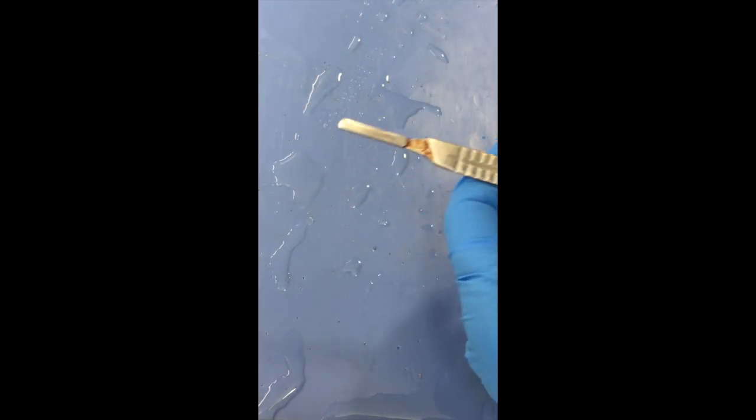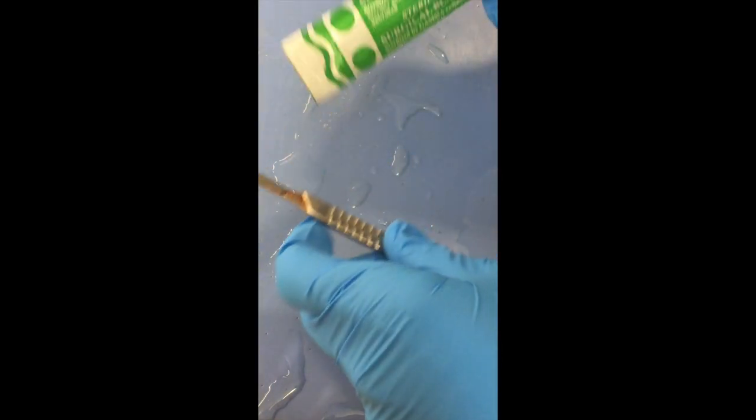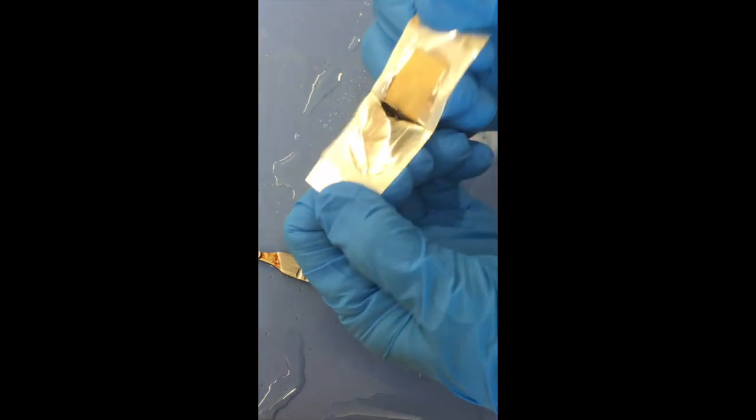Hello! I wanted to show you how to put on a scalpel blade. Is that exciting or what? So there's a little bit of a trick to it, so you might as well just see it up close.